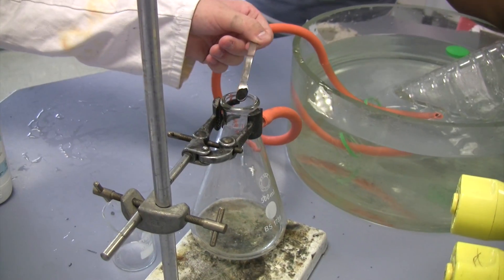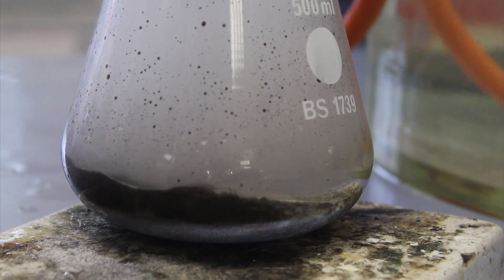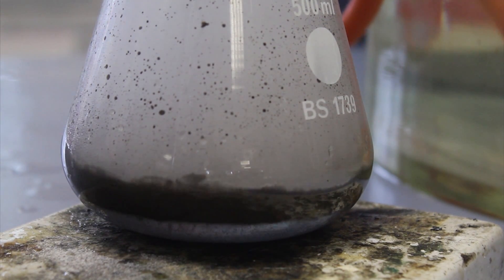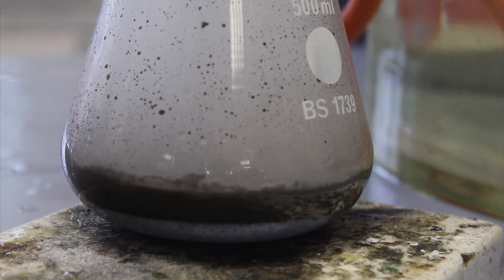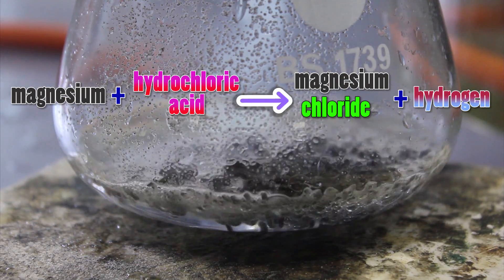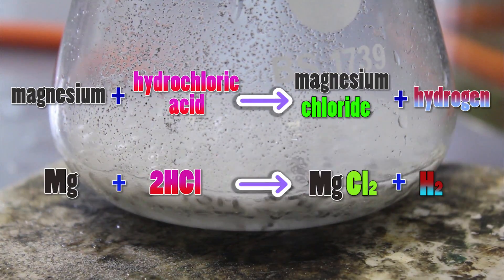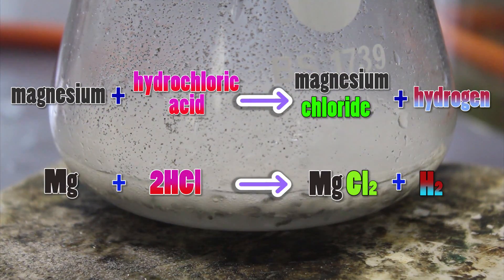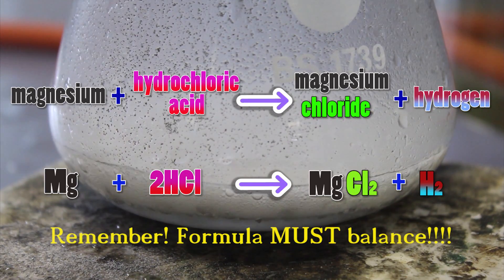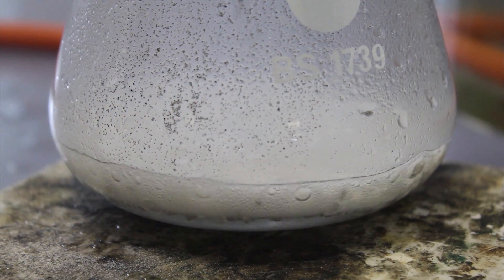All metals which are not too low in the reactivity series will react with acids to produce hydrogen. This is definitely the easiest way to make it in the lab. Here's the chemical formula: the positive magnesium ions join with the negative chlorine ions to make a salt - magnesium chloride. The hydrogen releases as gas. Look, you can see the bubbles.